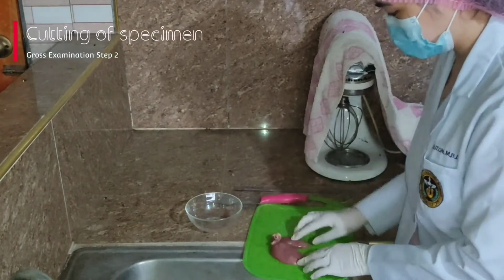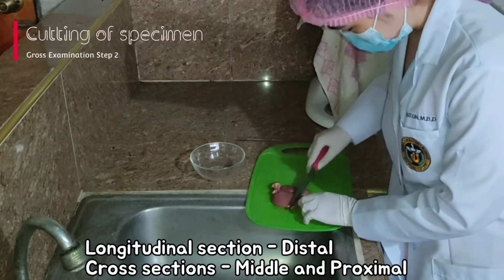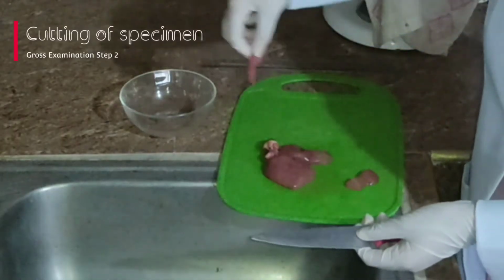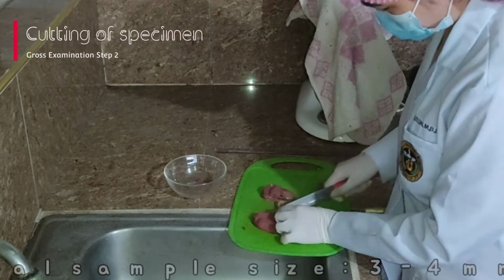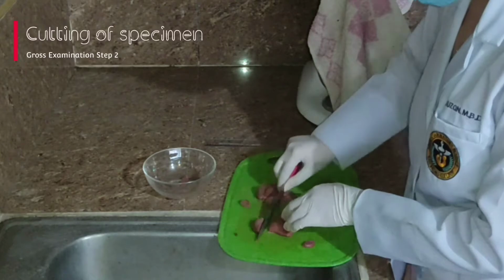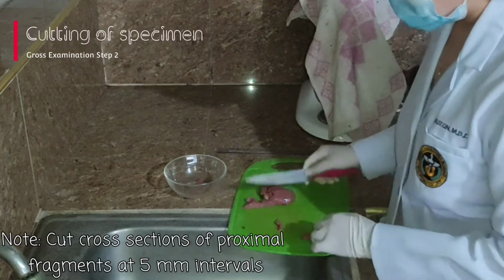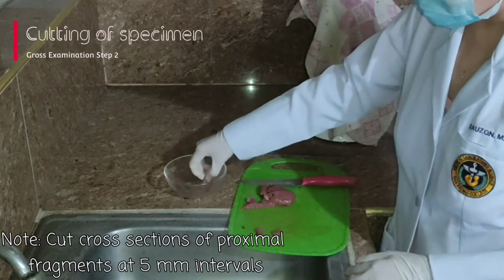In cutting, a longitudinal section must be done on the distal tip and cross-sections on the middle and proximal part. If there are visible abnormalities on tissue specimens, then that must be included. The sample must be about 3 to 4 millimeters for good penetration. In this procedure, I obtained 2 centimeters from the distal tip, 3 to 4 millimeters from the middle part, and 3 to 4 millimeters from the proximal part.